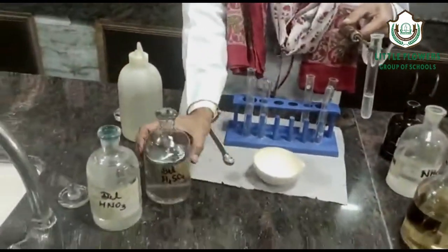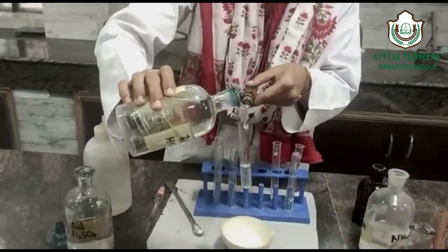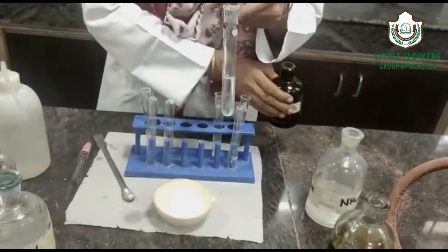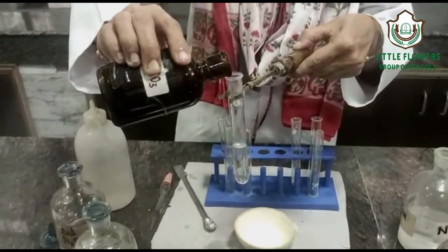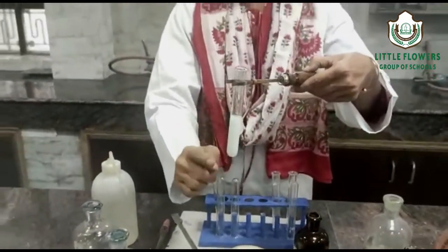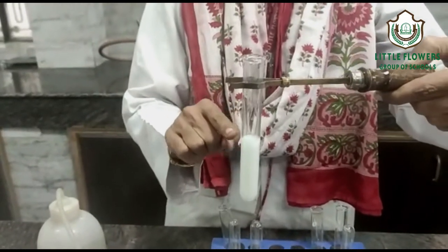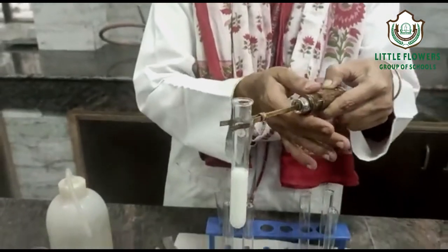To this aqueous solution, we add a few drops of dilute HNO₃ and then silver nitrate (AgNO₃). You can see a white precipitate has formed. This white precipitate shows that in the given salt, Cl⁻ — the chloride radical — is present.